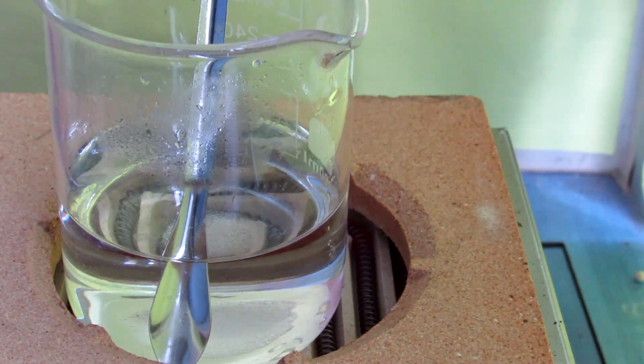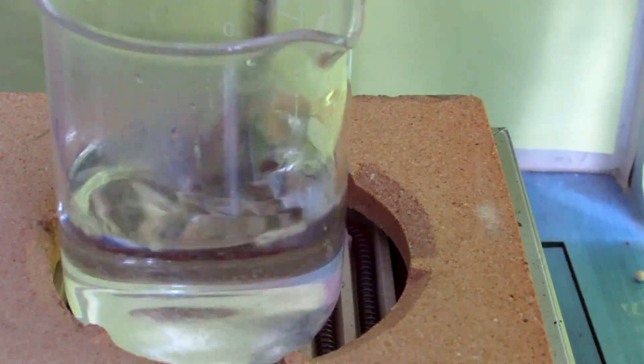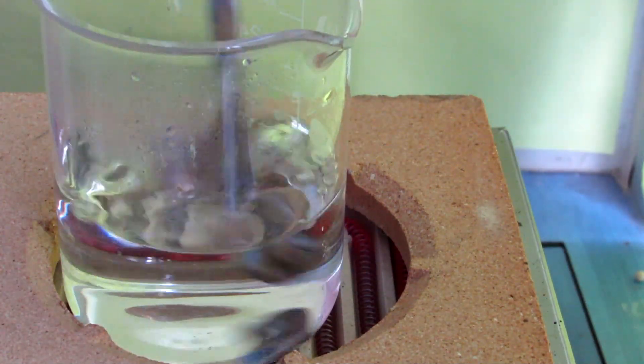Table sugar isn't really a reducing sugar. So to make some, a bit of citric acid crystals were added to the solution. I added about 3 grams in total. Then, heat up the solution and let it boil for about 5 to 10 minutes.